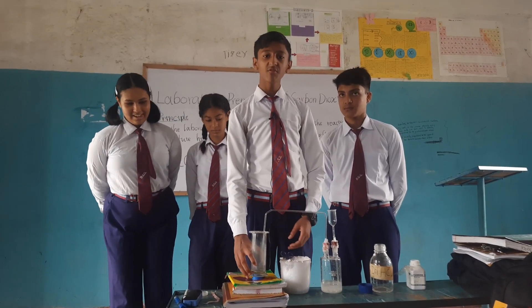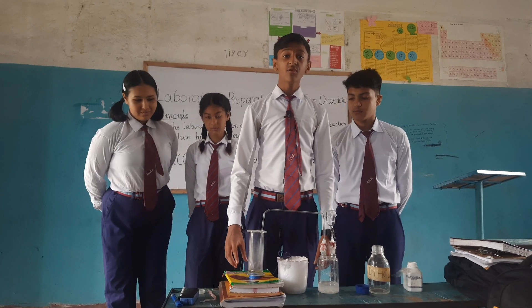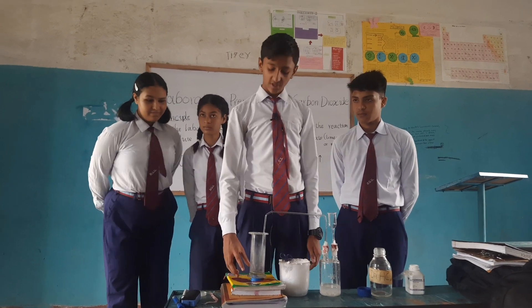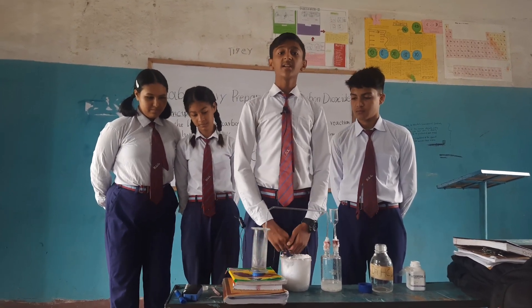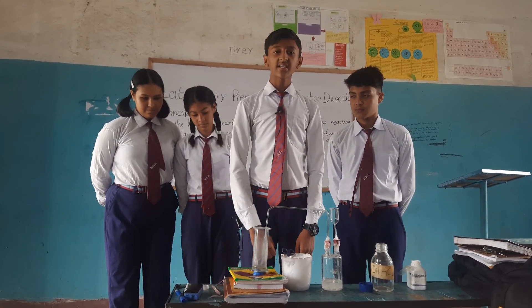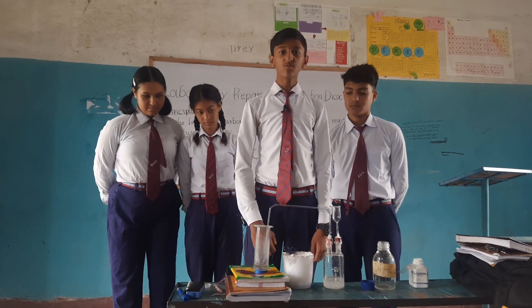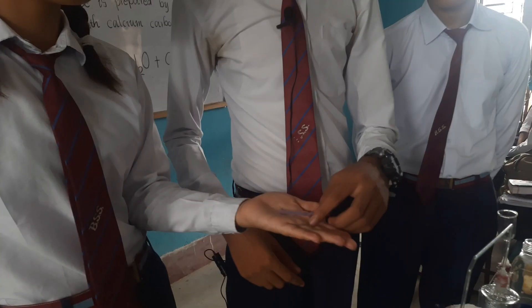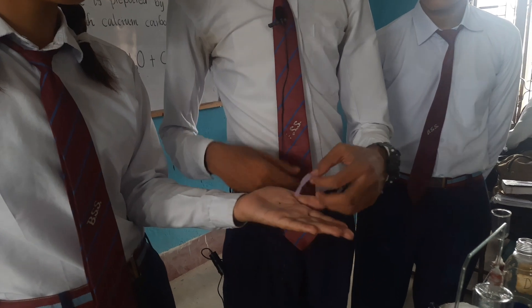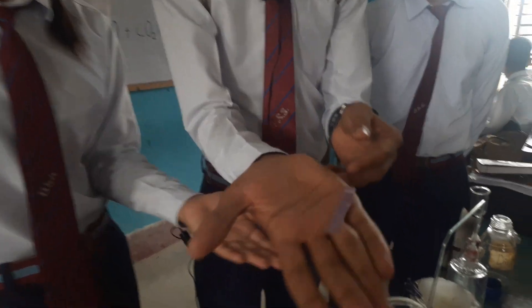There are many ways of testing carbon dioxide. We have done it here using litmus paper. As carbon dioxide is acidic in nature, it changes blue litmus paper into red. The blue litmus paper is changed into red after dipping it into the carbon dioxide gas.